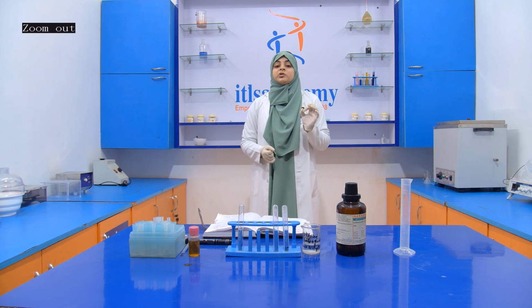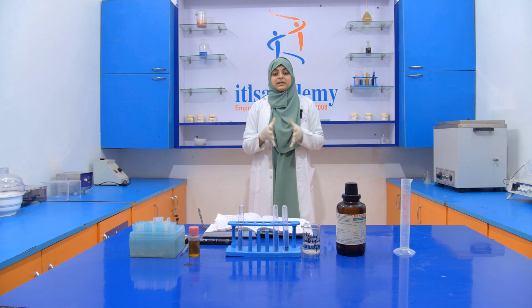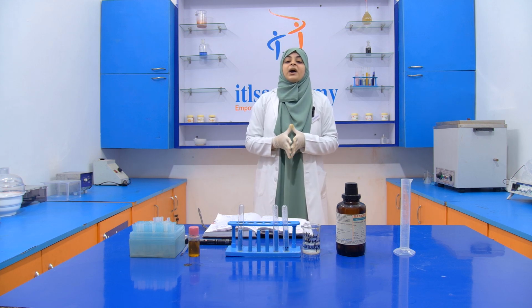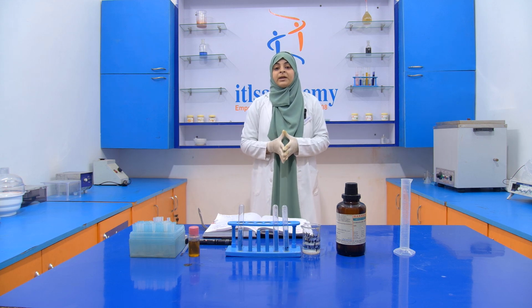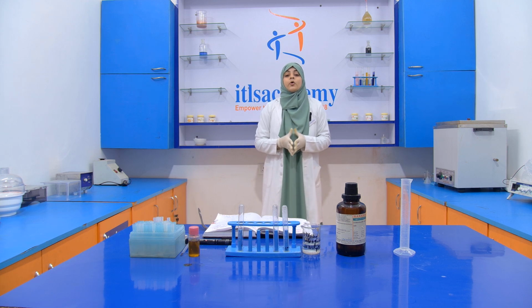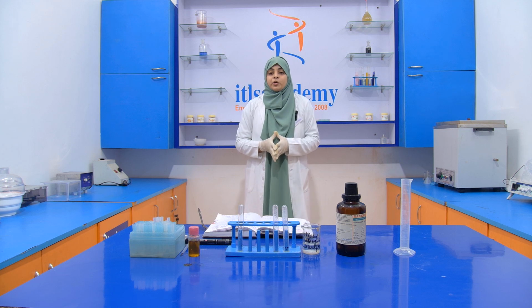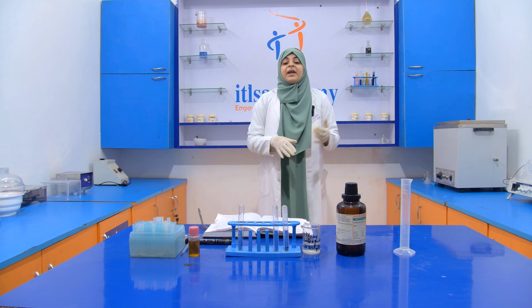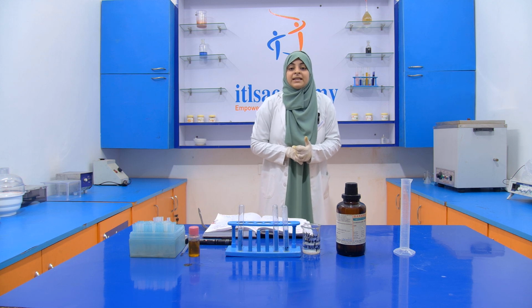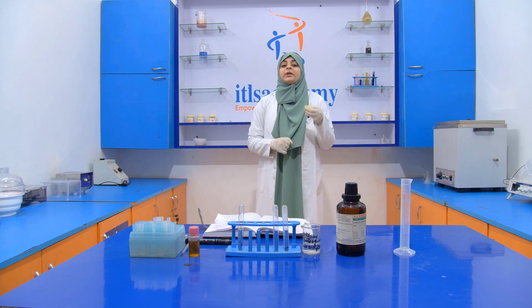Okay. So first of all, the first chemical that we are going to handle is concentrated HCl. We have to handle it very carefully because concentrated HCl is corrosive in nature. If it comes in contact with your eyes or your skin, it will damage your eyes and skin. If it is absorbed by your skin, it will cause irritation and also burn your skin.